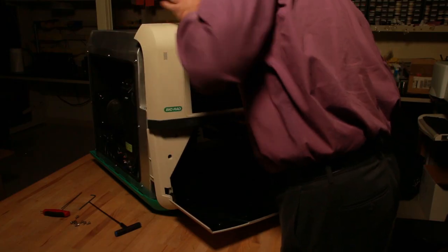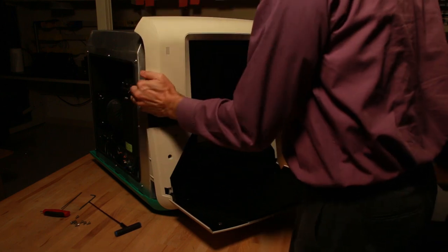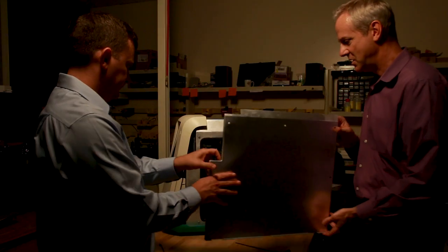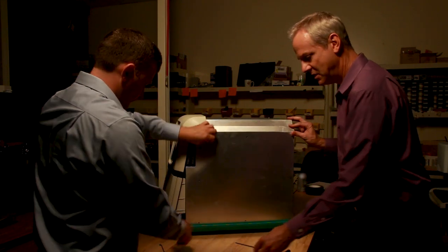I consider the ChemiDoc MP to be the best system out there for a number of reasons. One is its breadth of capabilities. This thing can do your nucleic acid samples, your acrylamide samples, your Western blotting samples. We're not really restricting a customer to do only what our system can do — we have a system which allows the customer to do what they want to do. They have all the options available to them and can choose what they think works best for them.